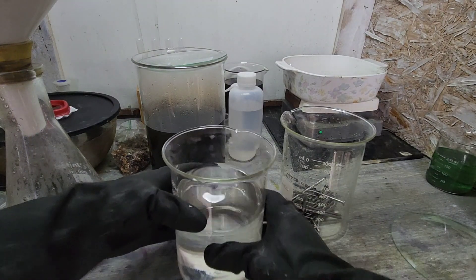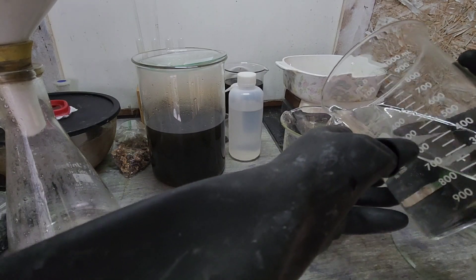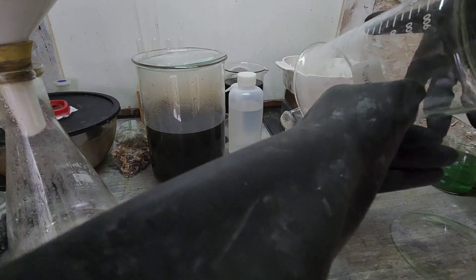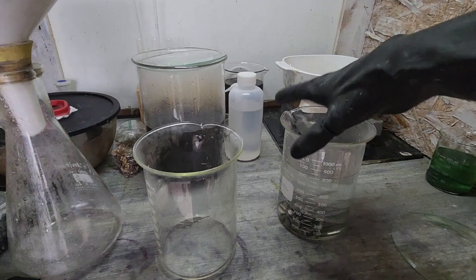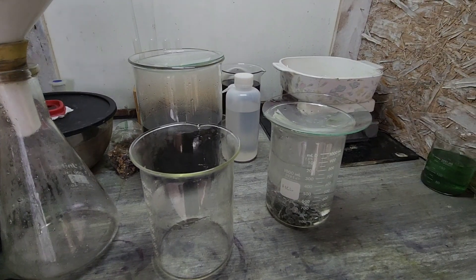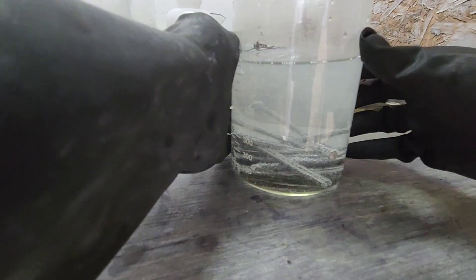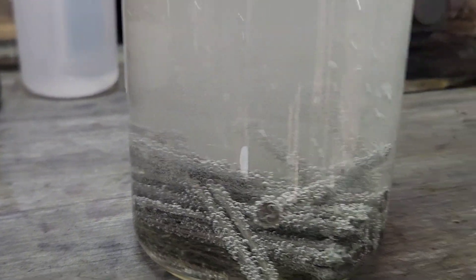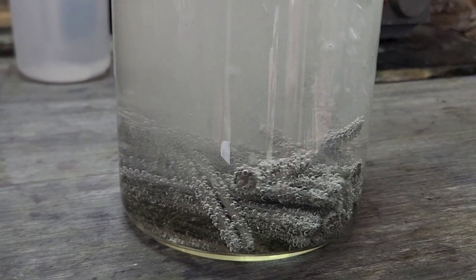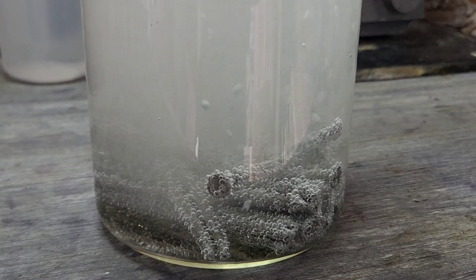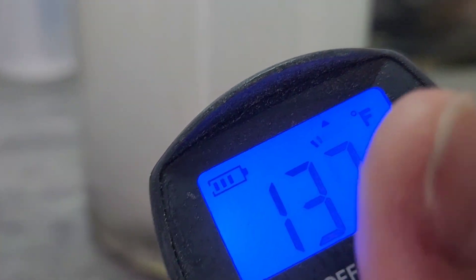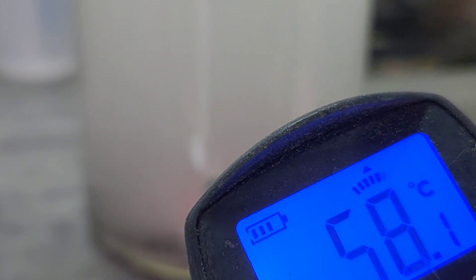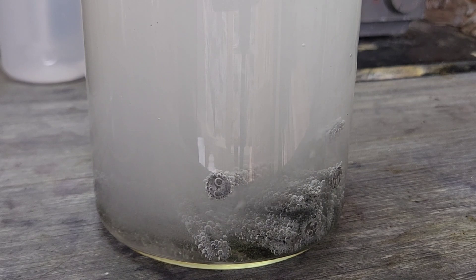All right, and we're going to go ahead and drop that in here and let that do its thing. It's attacking that iron right off the bat. 134, 58 Celsius.